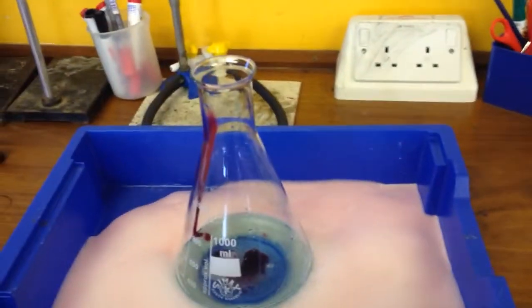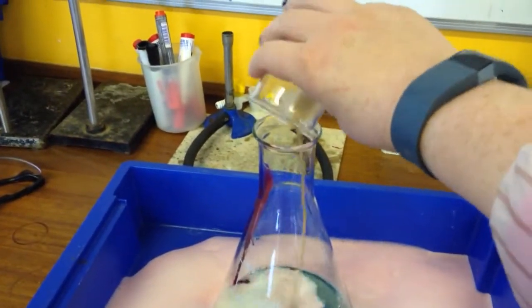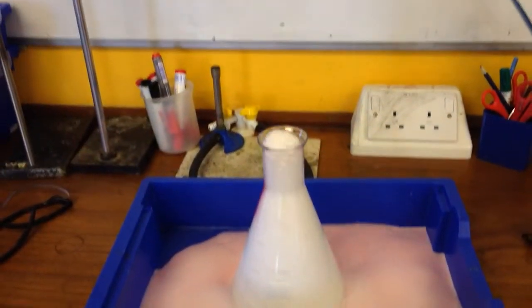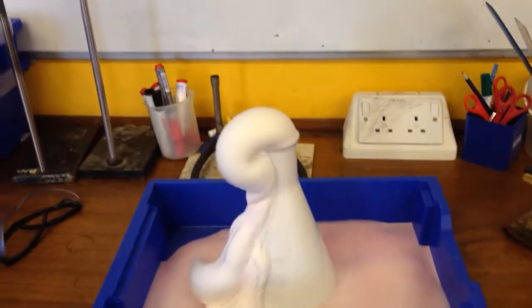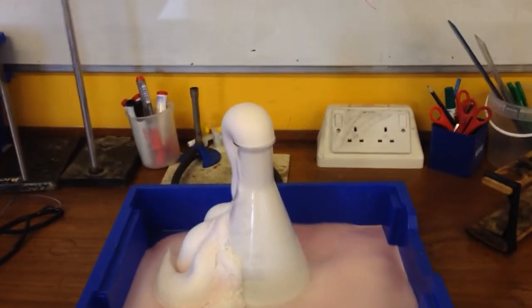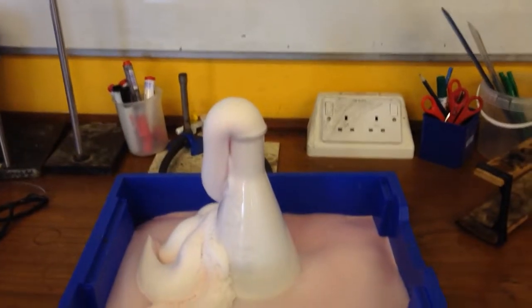So I'm just going to pour that in and step back. We can see a stripe coming out.